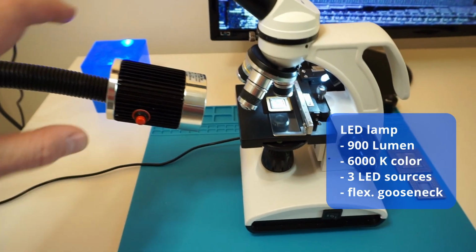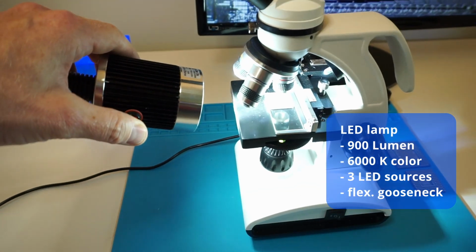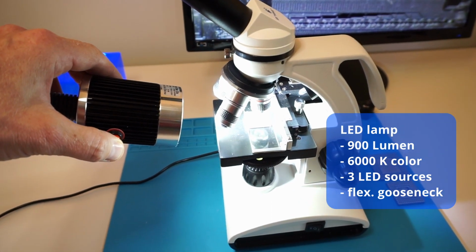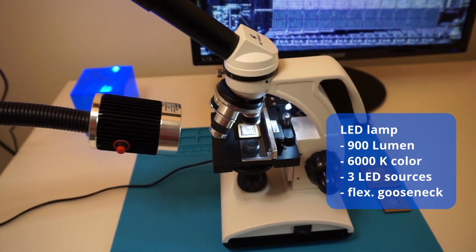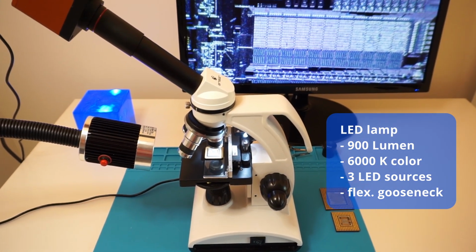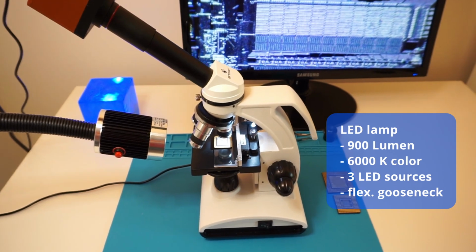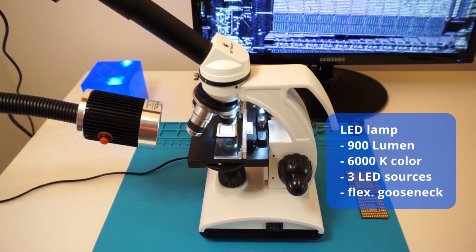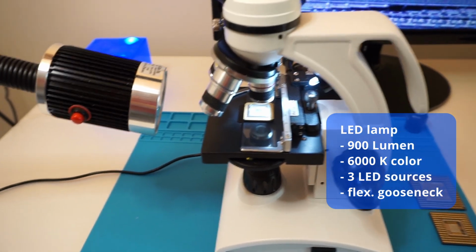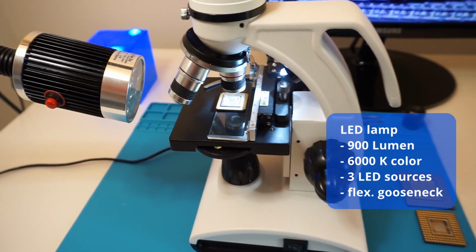The second issue was the light source. So just to show you here online, I have bought a very strong LED light. A couple of guys said in the chat that maybe having 2 or 3 would help. I have only 1 so far. Let's see if this works enough. Definitely, I'm very happy now.